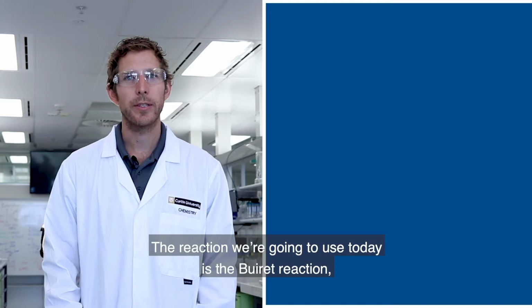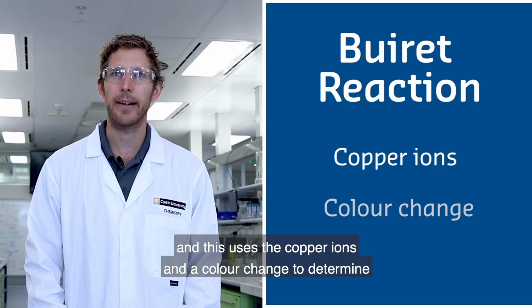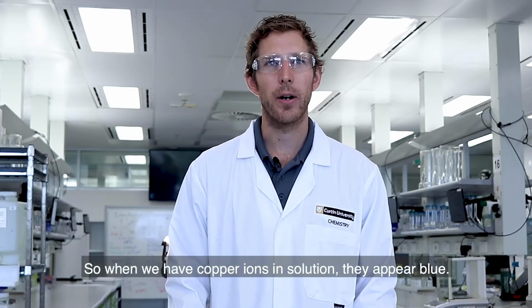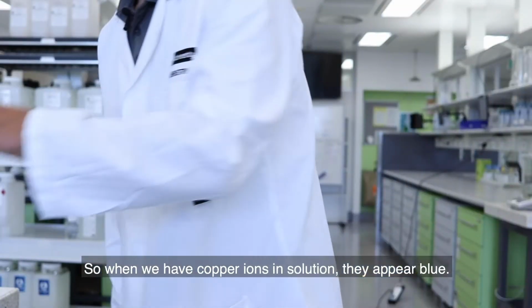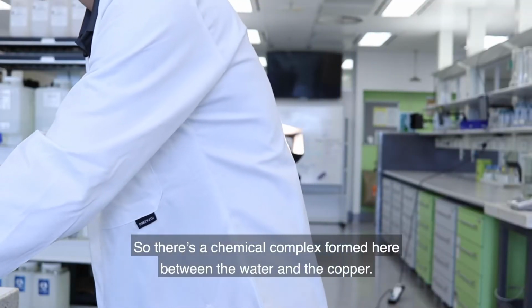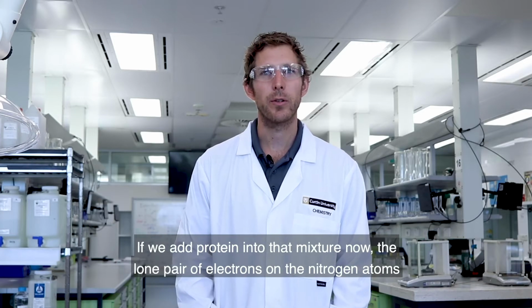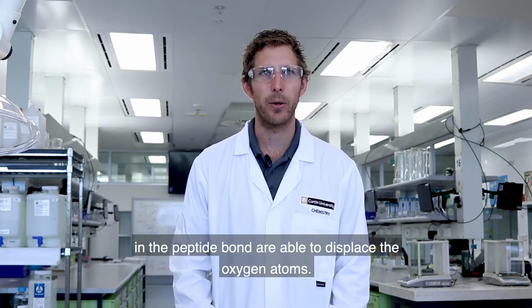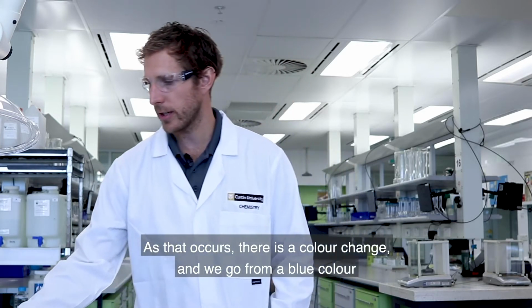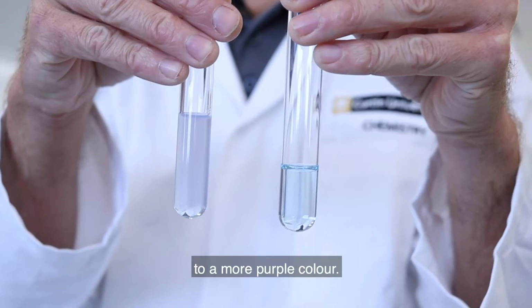The reaction we're going to use today is the biuret reaction. And this uses copper ions and a color change to determine if a protein is there. So when we have copper ions in solution, they appear blue. There's a chemical complex formed here between the water and the copper. If we add protein into that mixture, the lone pair of electrons on the nitrogen atoms in the peptide bond are able to displace the oxygen atoms. As that occurs, there's a color change, and we go from a blue color to a more purple color.